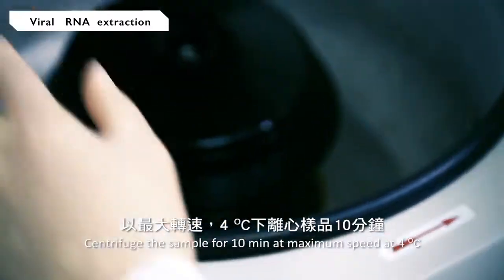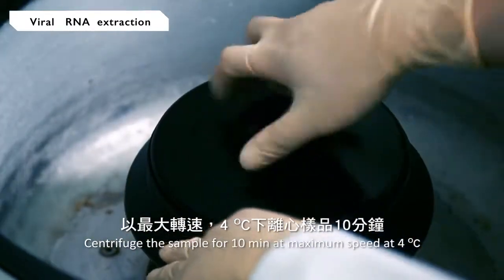Centrifuge the sample for 10 minutes at maximum speed at 4 degrees Celsius.